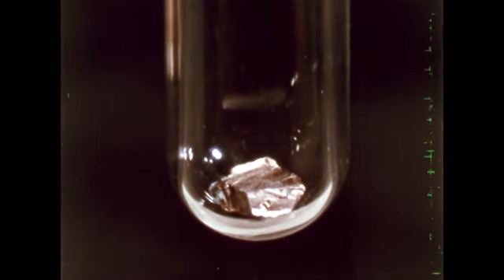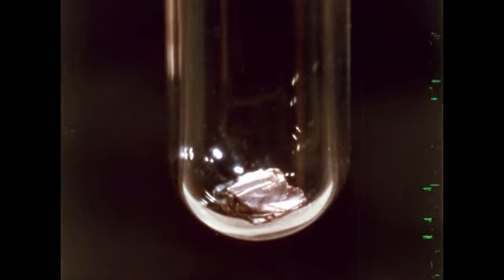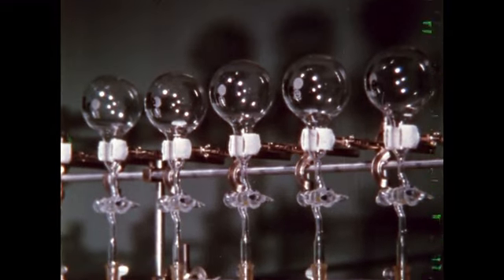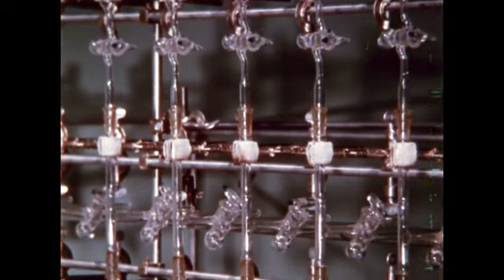Argon does not react, not even with molten lithium. Helium, krypton, neon, and xenon give identical results with lithium. We might tentatively classify these 5 inert gases as a family of chemical elements. Air reacted with phosphorus too. Let's try phosphorus with these 5 apparently inert gaseous elements.